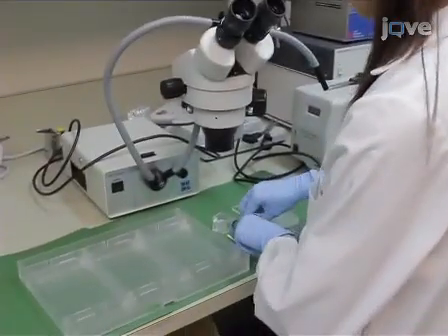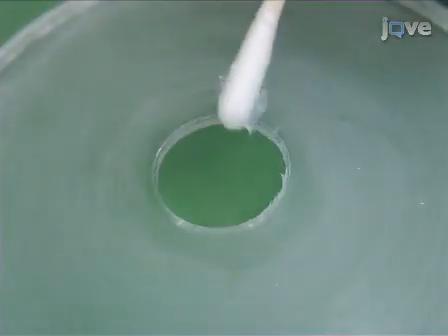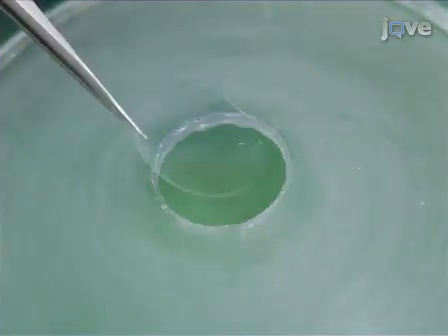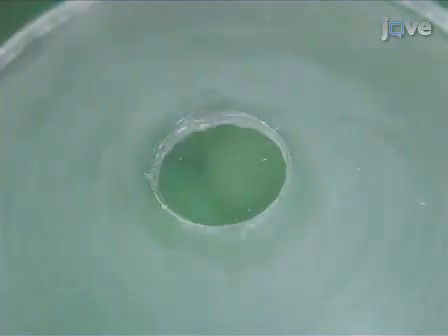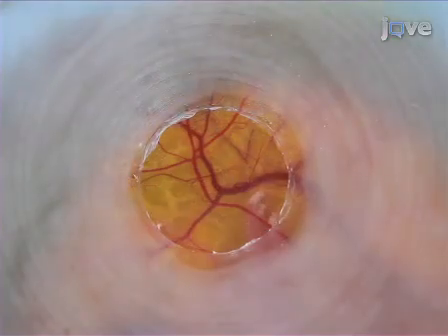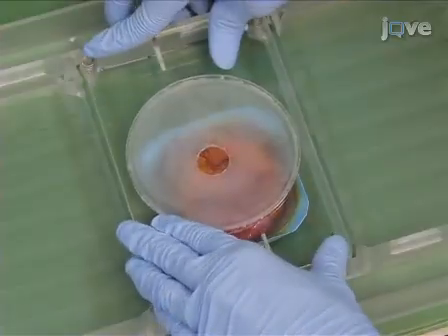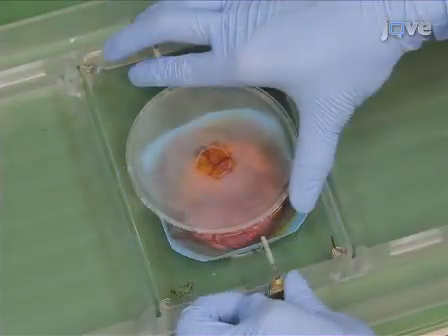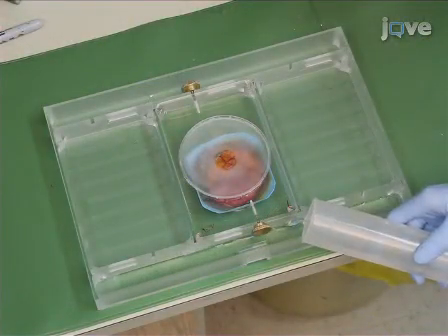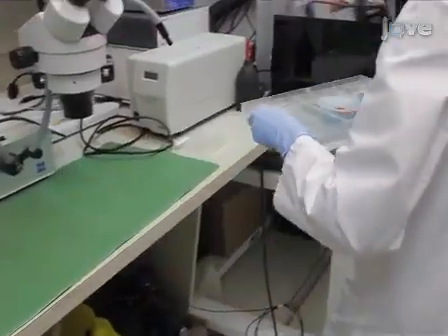Begin by preparing the embryo imaging unit. First, apply a thin layer of vacuum grease around the circumference of the imaging port on the underside of the lid. Then, fit an 18 mm glass cover slip onto the port. Now, load the embryo into the unit so the cover slip is above the desired area for imaging. Slowly lower the unit's lid until the cover slip just makes contact with the embryo and screw the lid in place. Now, fill the dish containing the embryo and imaging unit with 37 degrees Celsius water. This unit will hold the embryo in place under the spinning disc confocal microscope.